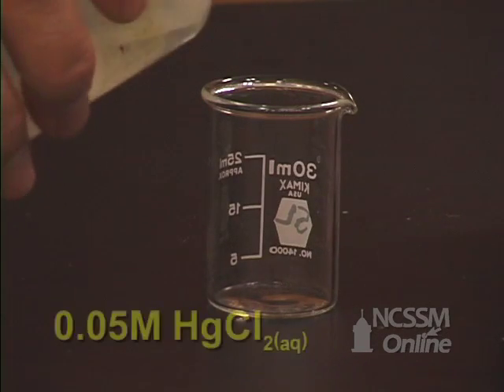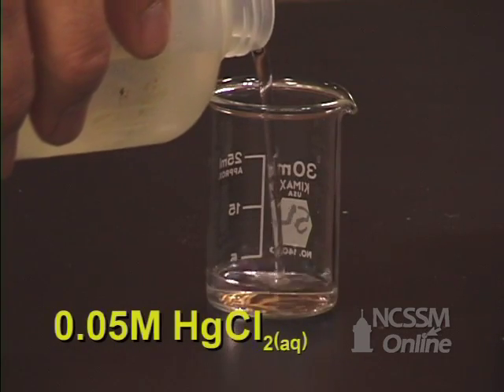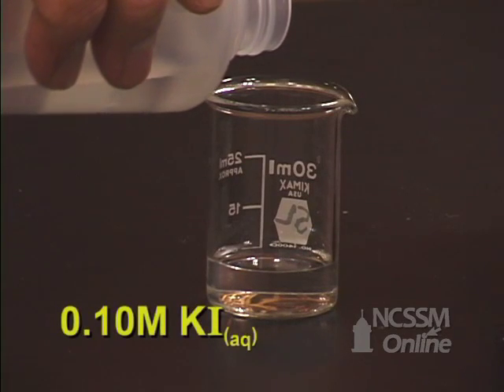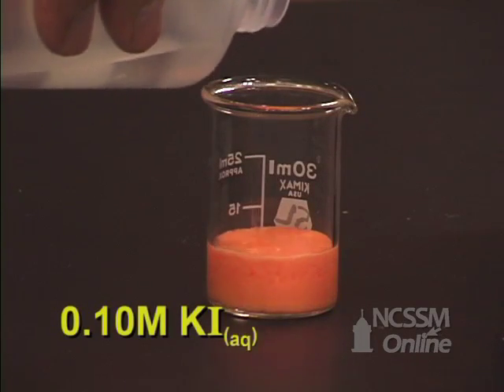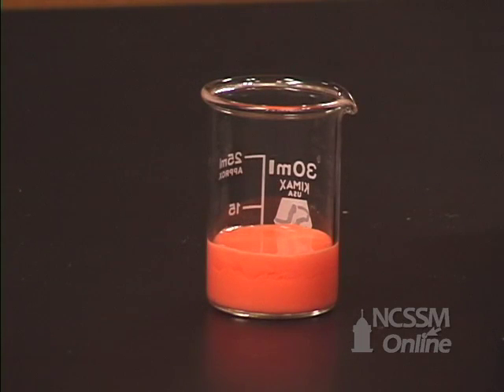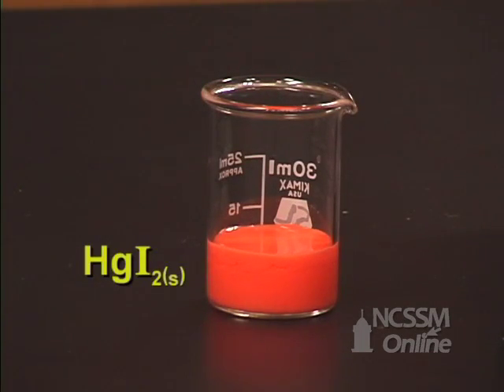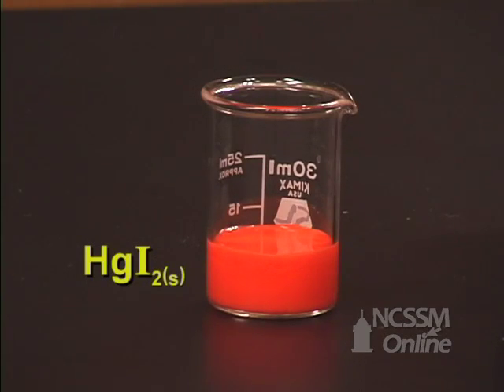We will put a 0.05 molar solution of mercury chloride in a beaker and add some 0.1 molar potassium iodide. We notice the formation of a reddish-orange solid. This solid is the product of thermodynamic control — it is the more stable product.